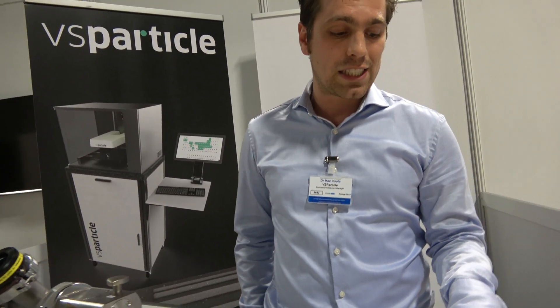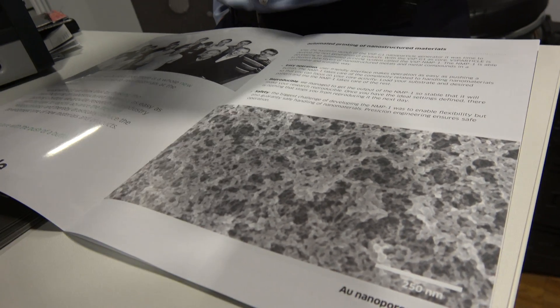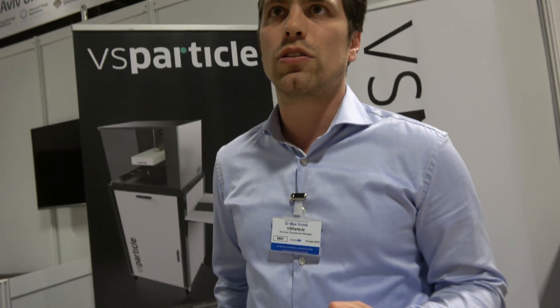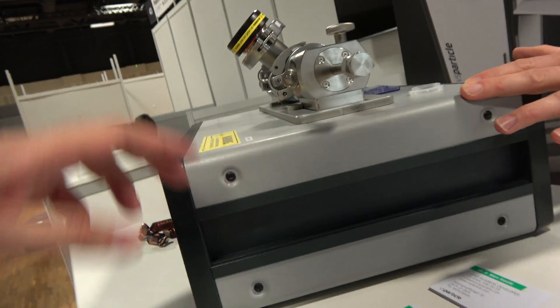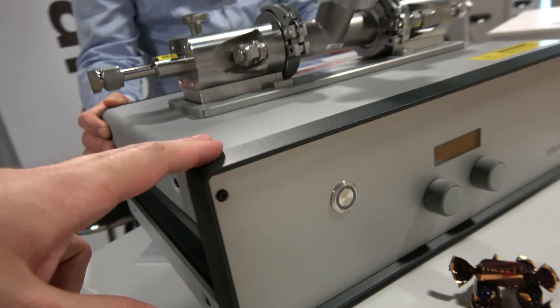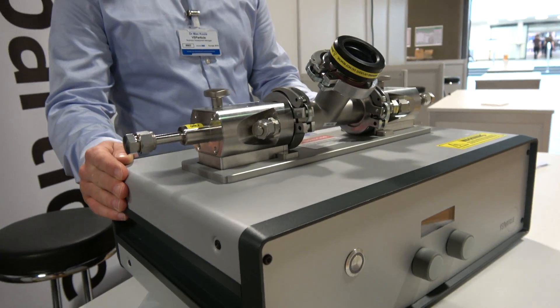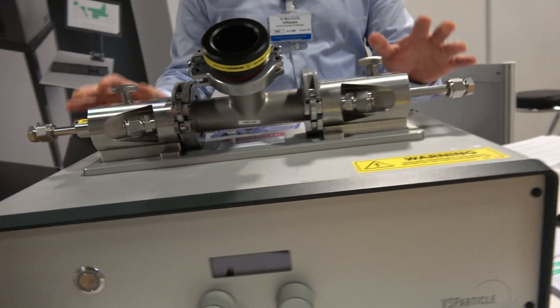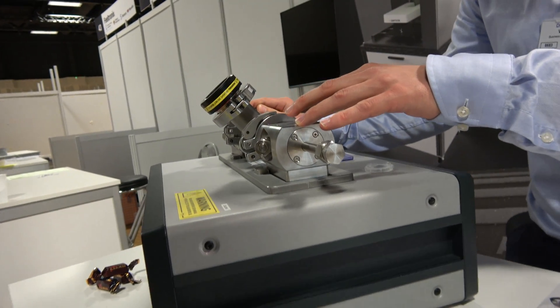Other things you can do: if you heat these lines, they melt really quickly, already at 200, 300 degrees Celsius, so you can really locally pattern these materials. This is the generator we have at this moment. Inside the box is all the software to control and the high-voltage supply. This is just the generator, which we sell commercially now and globally.